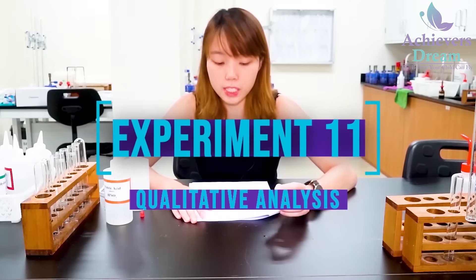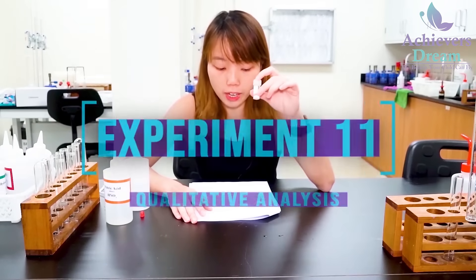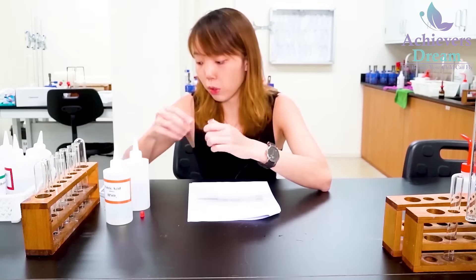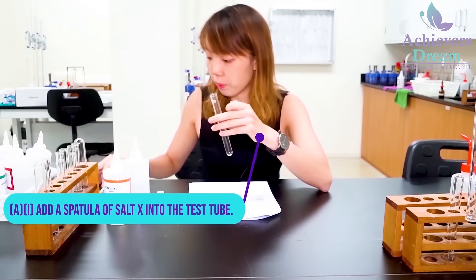Today we'll be doing experiment 11. We are provided with 3 salts: X, Y and Z. For the first step, I'm going to add a spatula of X into a test tube.